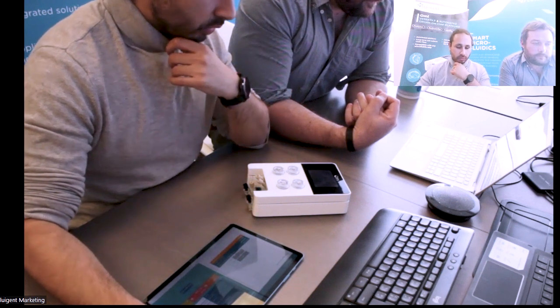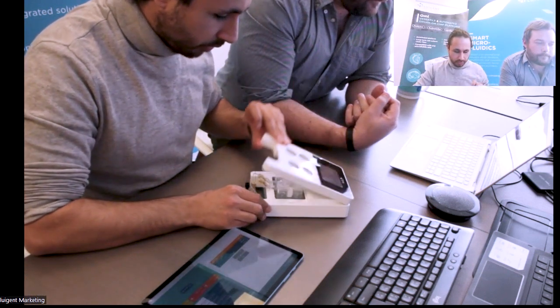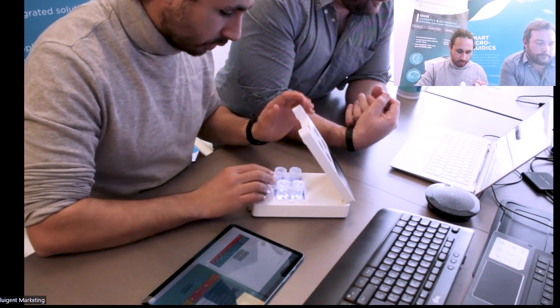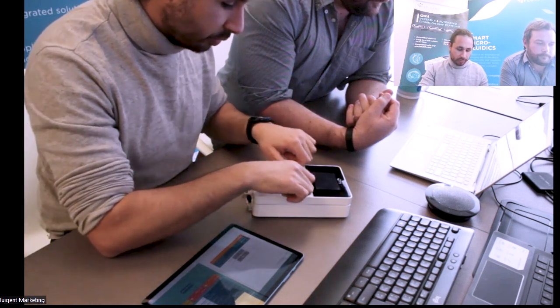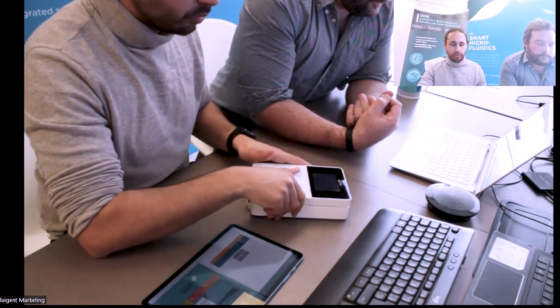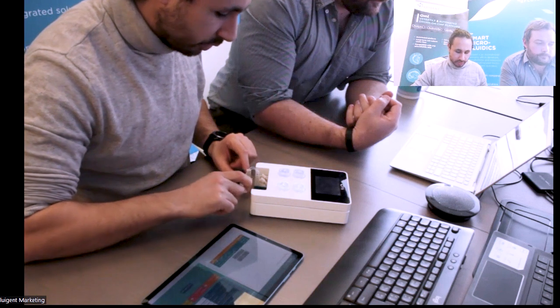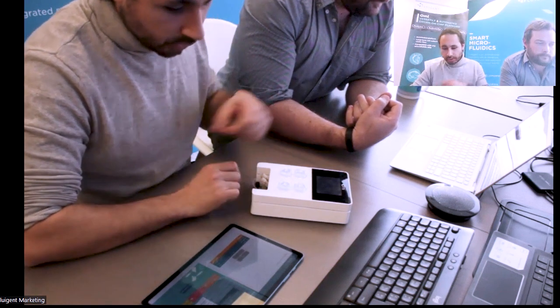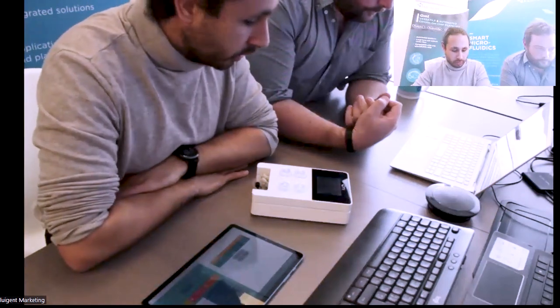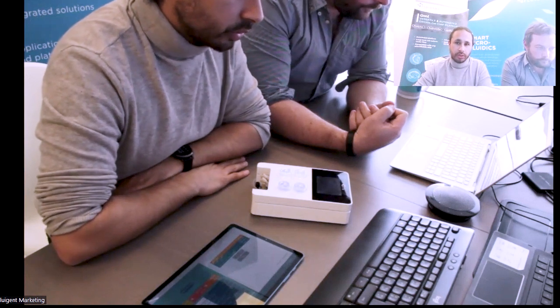And maybe to also clarify something: I don't know if we have said it really well, but the cartridge and adapter are consumable. So if you are buying on the platform, it contains a triplicate of the cartridge and adapter. And the idea is that for each experiment, you are using a different cartridge and adapter.